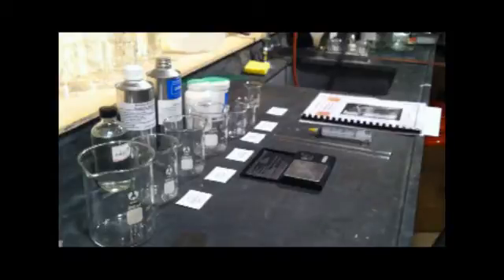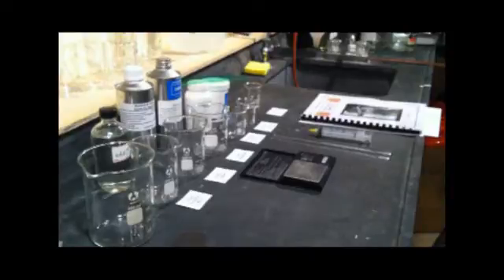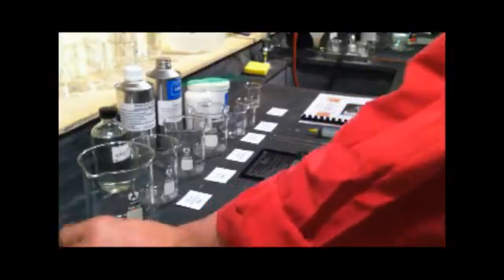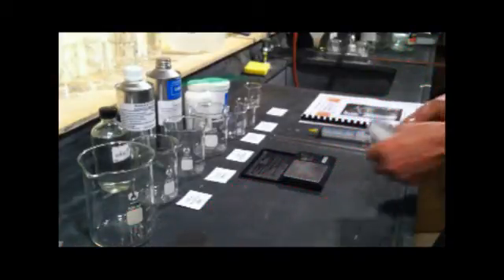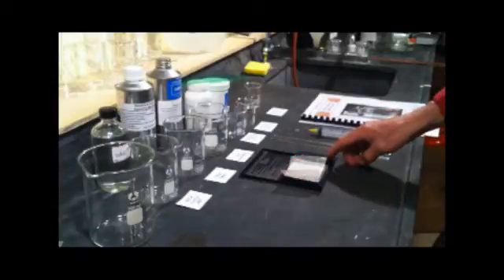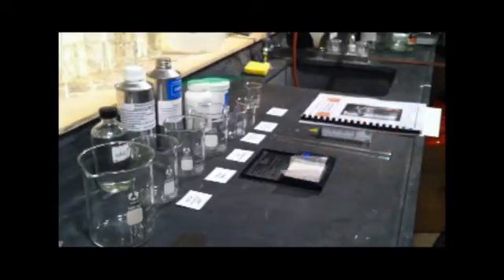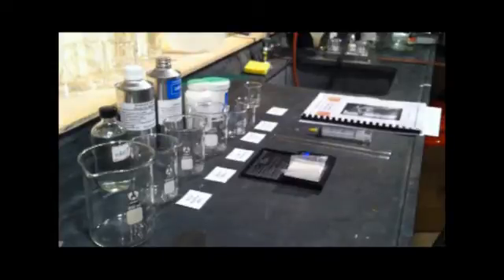To begin, we'll measure out the powders, the cadmium bromide and potassium iodide, and then dissolve them in water. To weigh them I'm first going to put a piece of waxed paper on the balance pan. When we turn that on it should zero, which says it's accounted for the weight of the waxed paper.